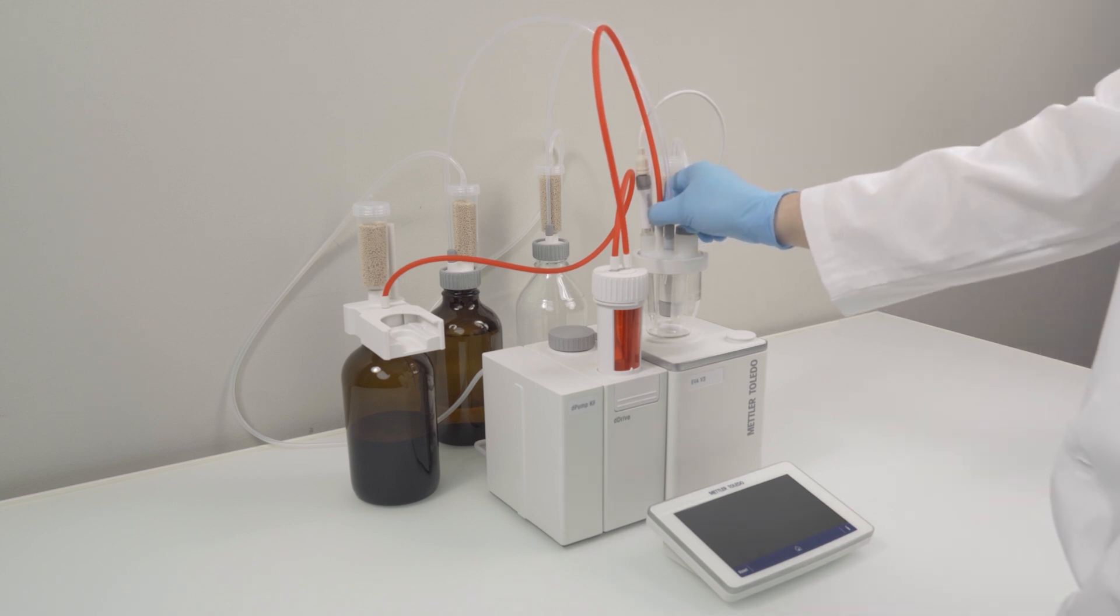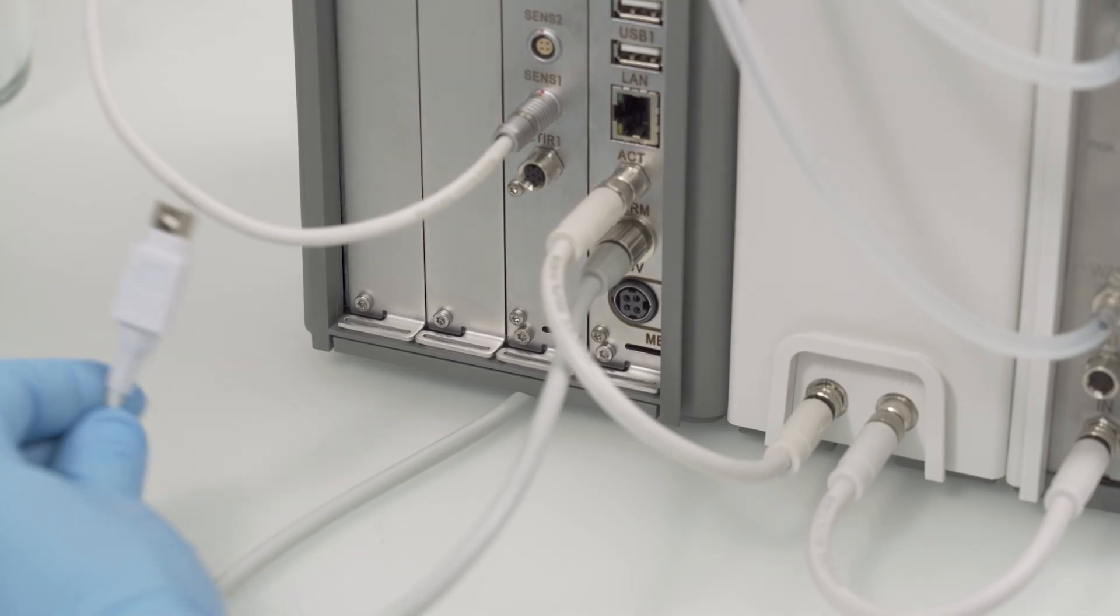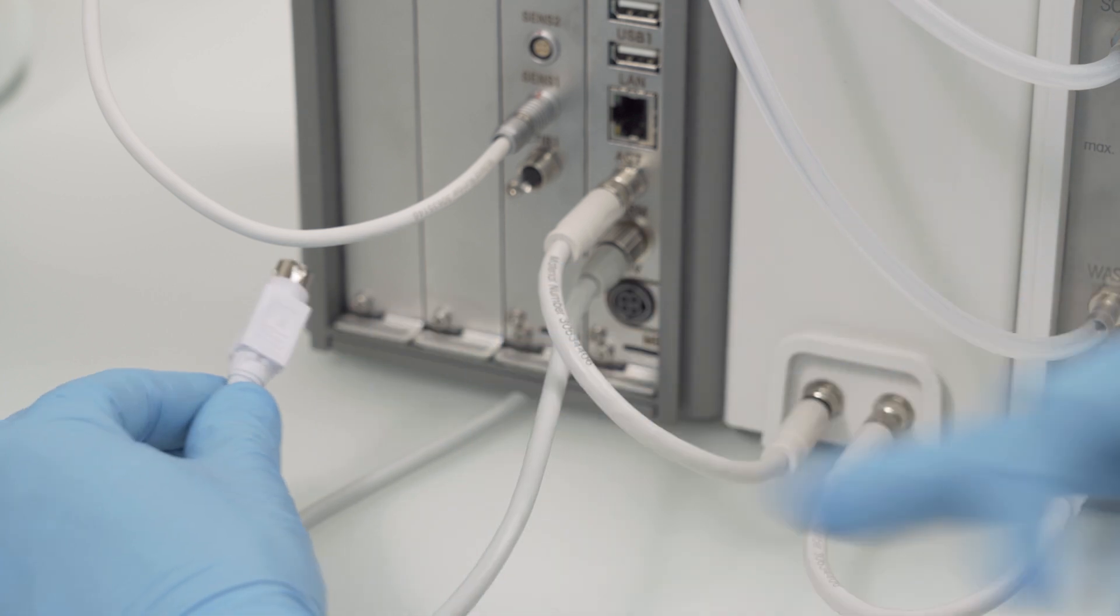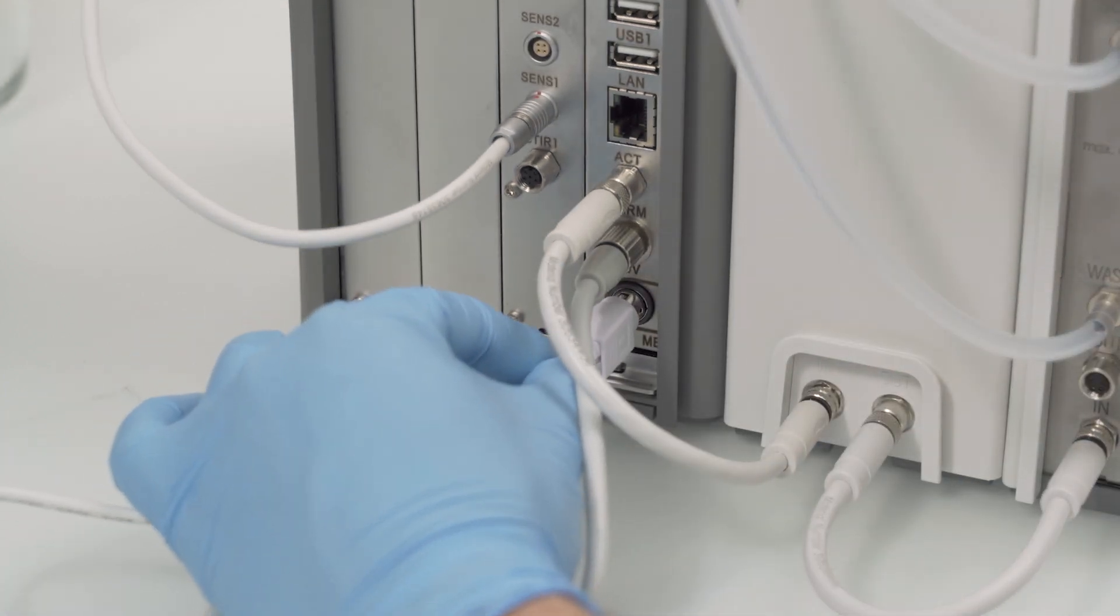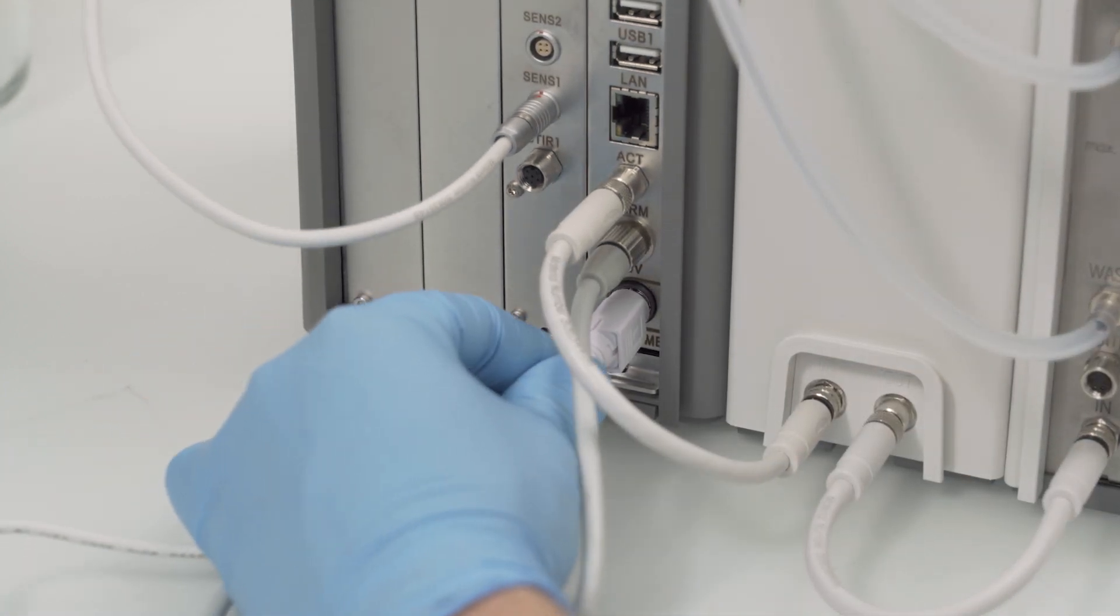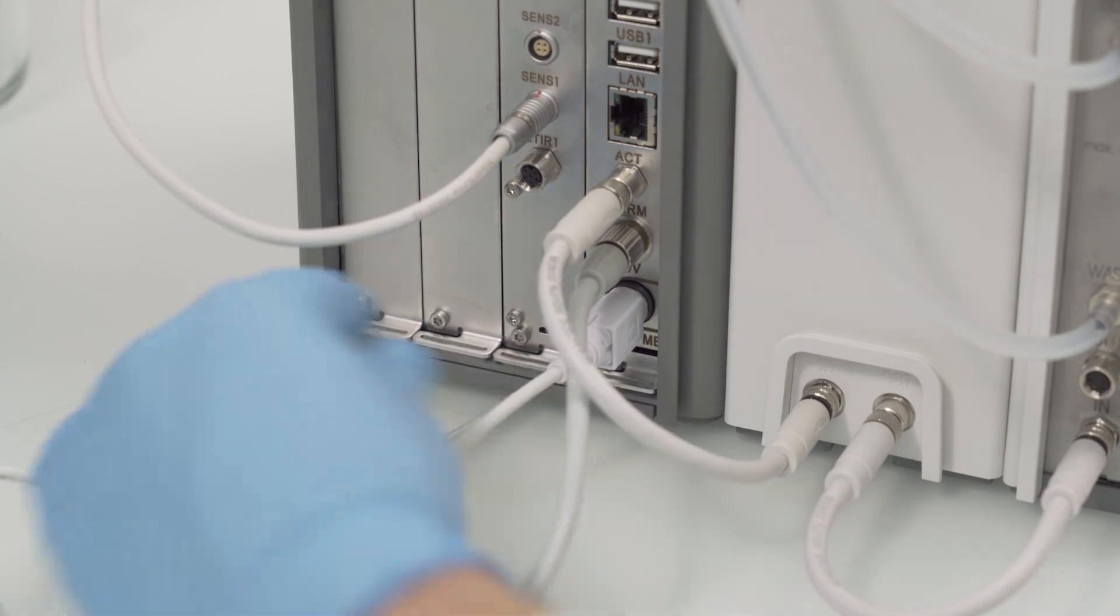We are finally approaching the end of our installation video. The last part missing is the power supply. Take the power cable aligned with the socket as indicated on the mainboard and push it in to finish the installation.